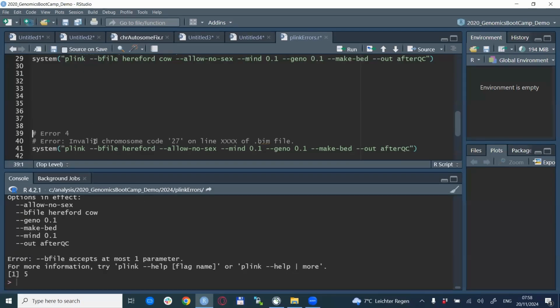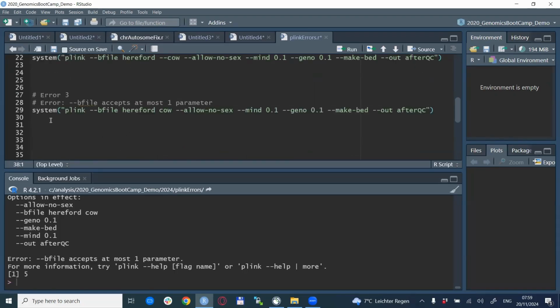So here what we see is correct for the dash dash b file, but afterwards there should be dash dash cow here for accounting the chromosome numbers. But these dashes are missing there, and then PLINK counts the keyword cow also as a part of the line for the dash dash b file. And that's why it thinks this is the first parameter, and this is the second parameter. And the second parameter already should not be there. Therefore, it complains because b file accepts only one.